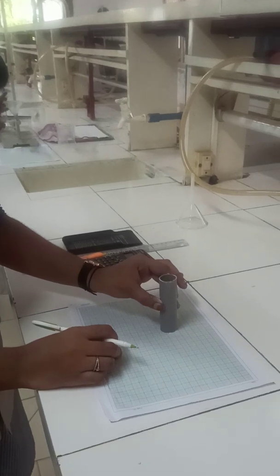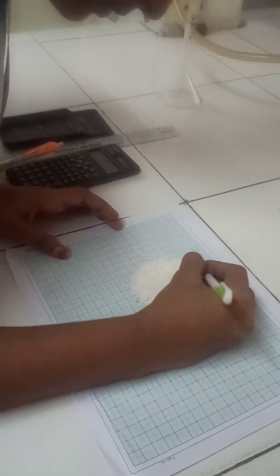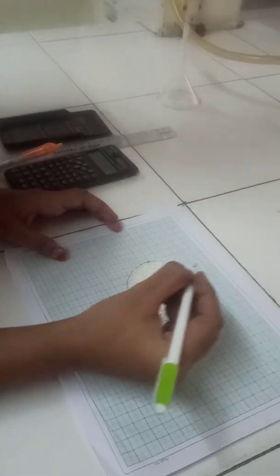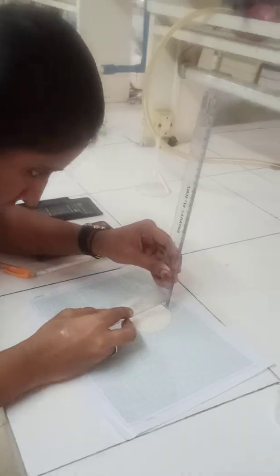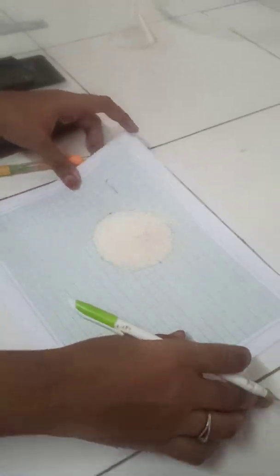Now remove the open cylinder slowly. The particles will flow down and form a pile. For this pile, make a circle. Now measure the height of the pile — one scale is placed vertically, another horizontally, with the horizontal scale just touching the pile. The height of the pile is noted in centimetres, which is 1.5 centimetres.